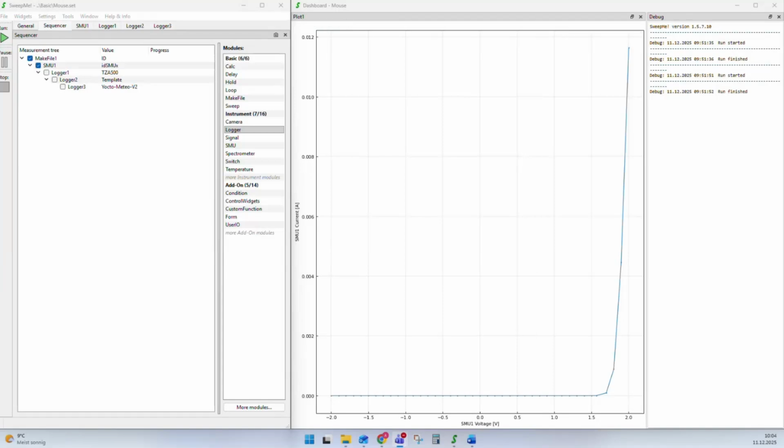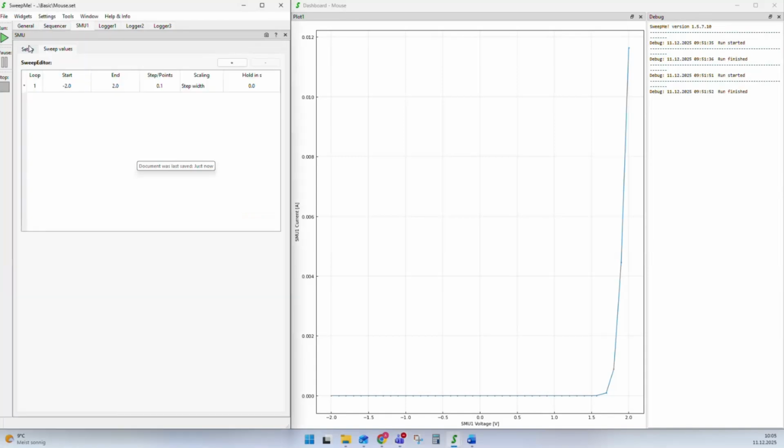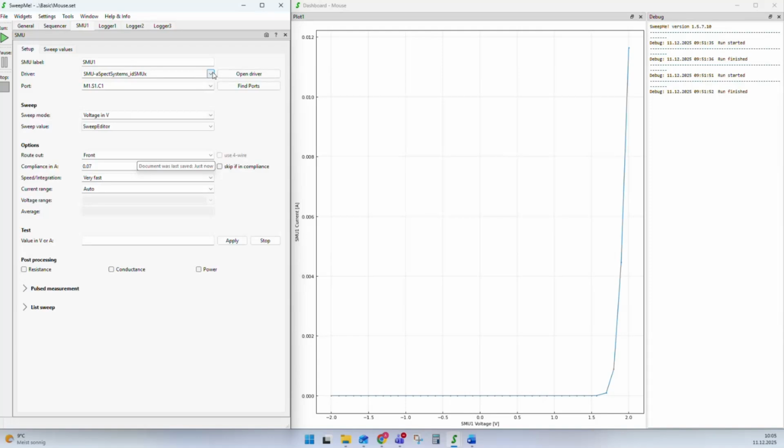The first topic is actually: what is an instrument driver? In SweepMe, you can find the instrument driver if you go, for example, to the sequencer where you have your modules. Some of these modules are called instrument modules, and these instrument modules can load instrument drivers, for example an SMU module or a logger module. I have already added them to my sequencer, so we can go here to the SMU module.